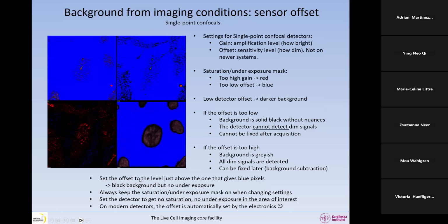So set the offset level to just above the level where you get a few of these blue color-coded pixels, just above that, and that is the good offset level. So we do not want a completely black background. We want a black background, but no underexposure. So when you put the color mask on, we do not want this to be blue. Always keep the saturation and underexposure mask on when you change your settings so that you can detect if you're going too low or not.